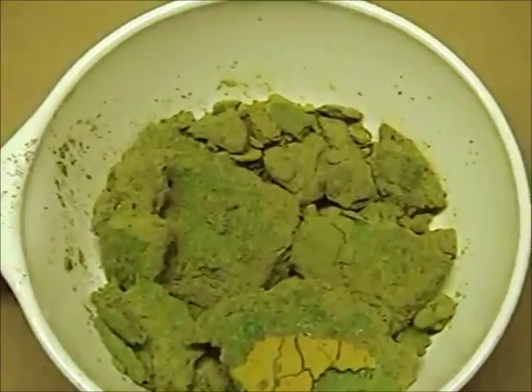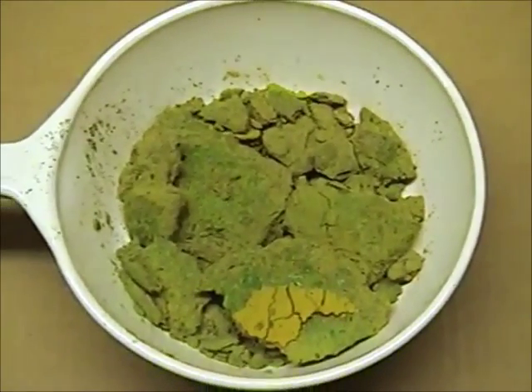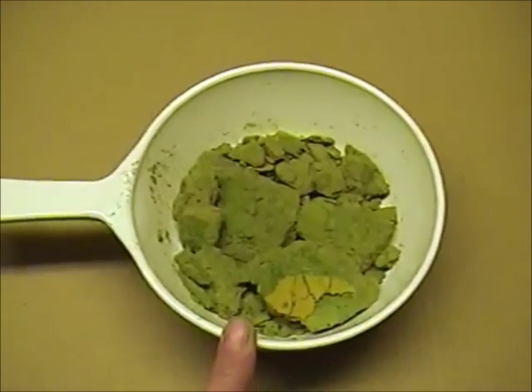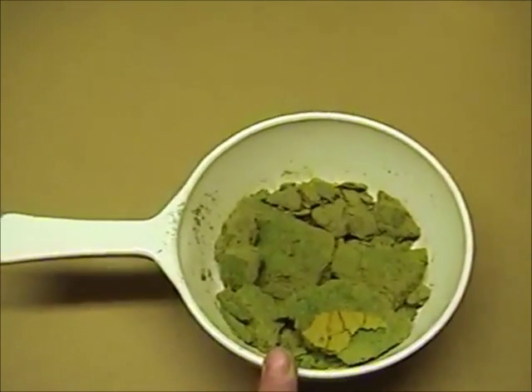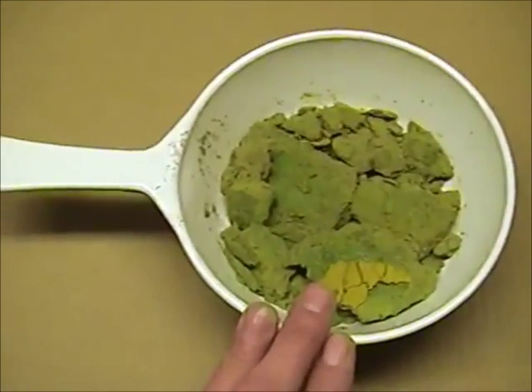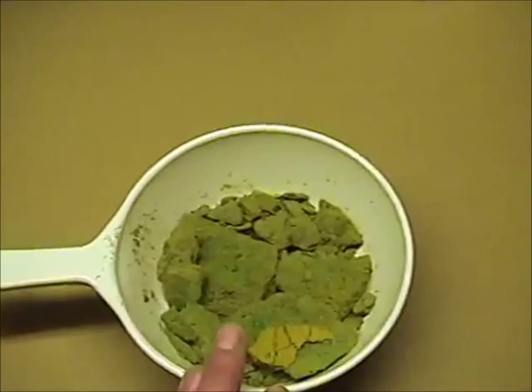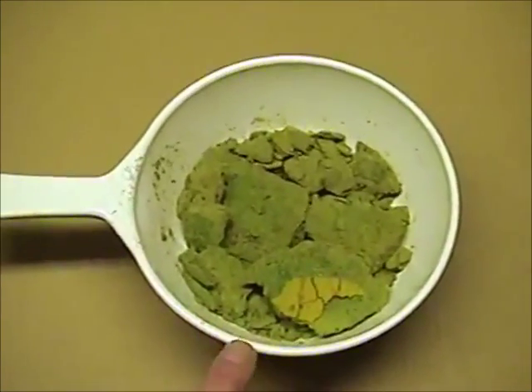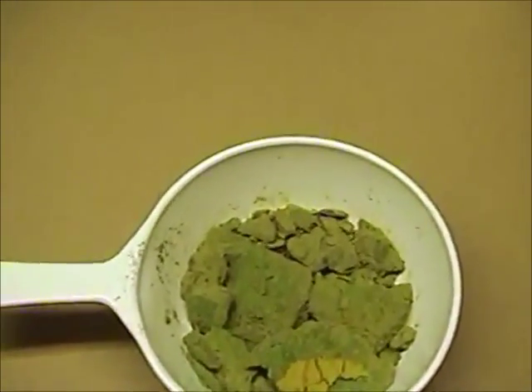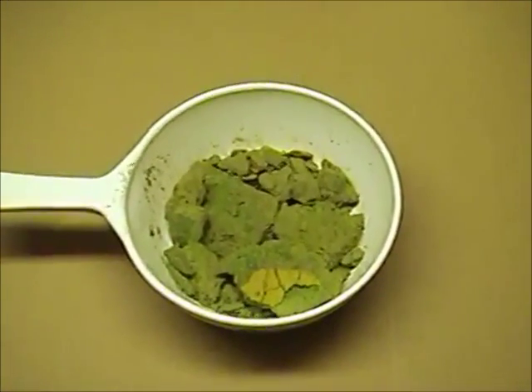And that's exactly what we have here in front of us. Because I don't have any sterling silver for this experiment, this is what I'm going to use. Sterling silver is about 92.5% silver and 7.5% copper. I'm going to call this a little dirtier than that — maybe 80% silver, 20% copper — which is even better for testing the claim that this process works even from a dirty solution.